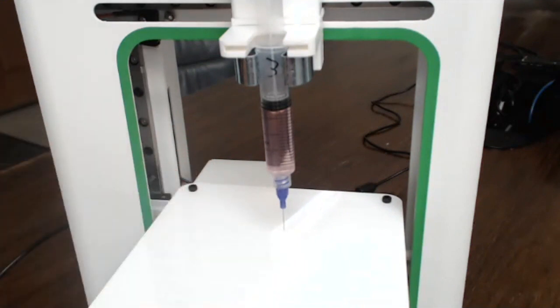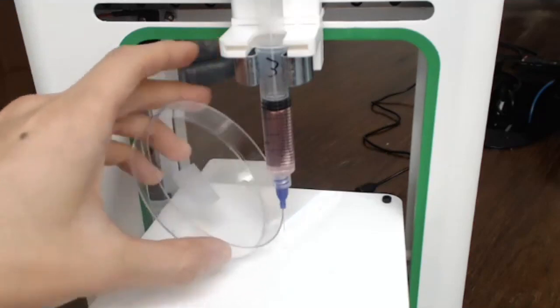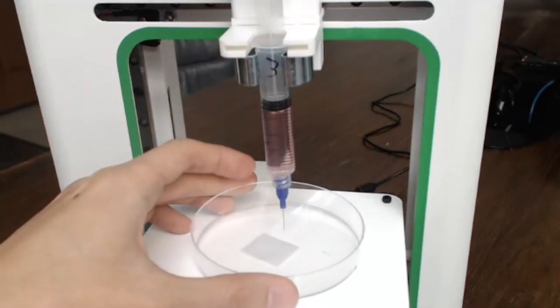So it's a bit hard for you guys to see, but here we have a 30 gauge needle, which is fairly thin. It's probably as thin as you can get with these disposable type needle tips. And Oliver will show you, I guess, the good print first. Yeah. So I have a slow version that I just made, and then also a fast version where you'll see that the speed really does make a difference.